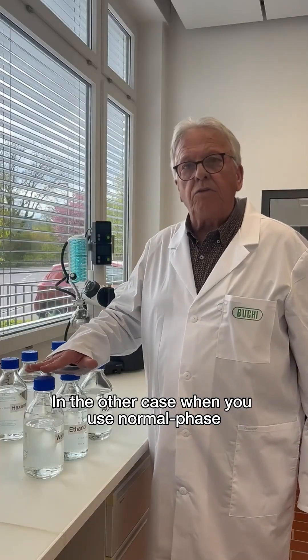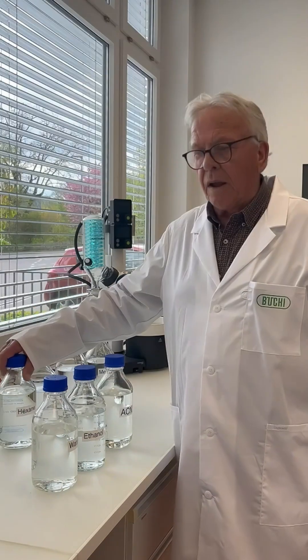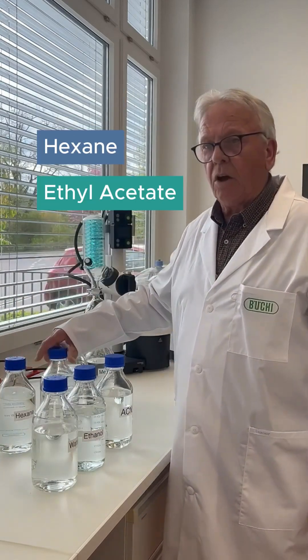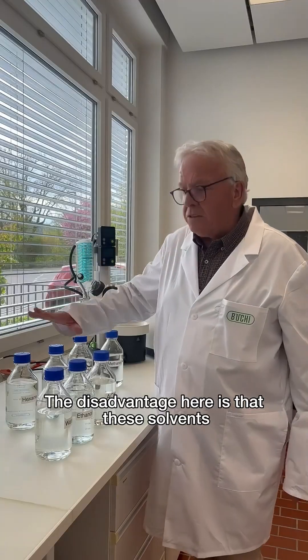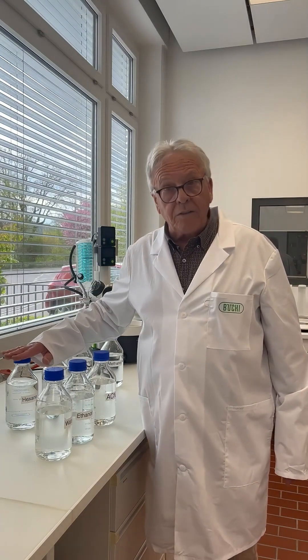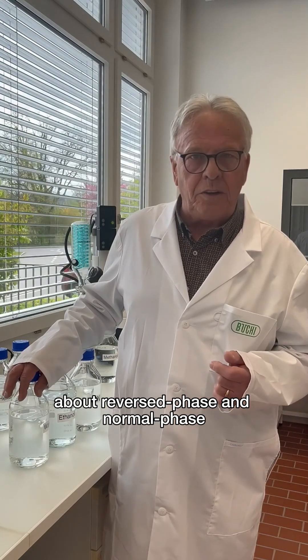In the other case, when you use normal phase, that's a polar stationary phase with some apolar solvents, like, for example, hexane in combination with ethyl acetate, or DCM in combination with methanol. The disadvantage here is that these solvents are toxic. But the advantage is that they are easy to evaporate after your separation. This was it from my side about reverse phase and normal phase.